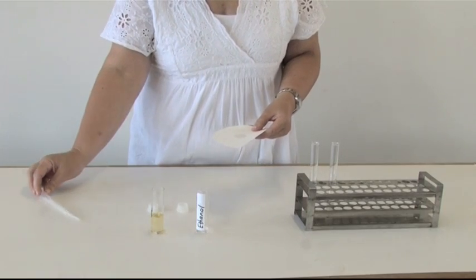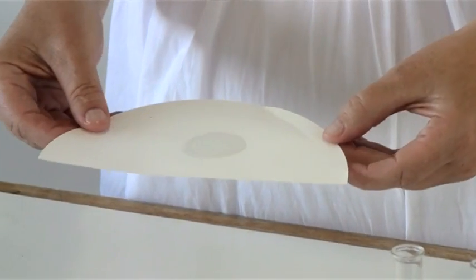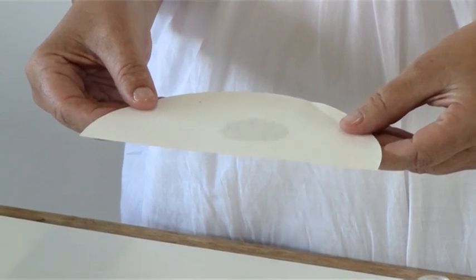When dry, note the translucent patch. This will be a positive test for fats.